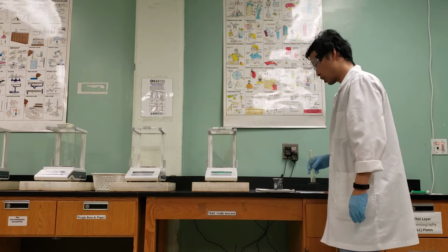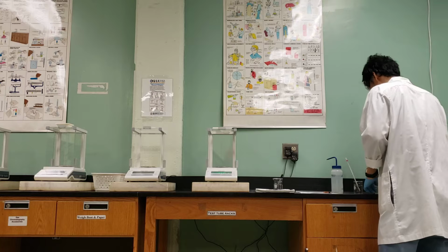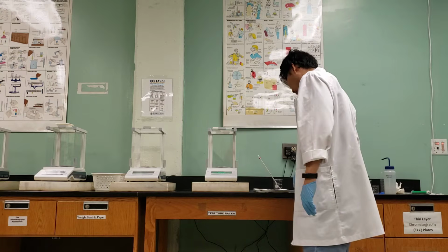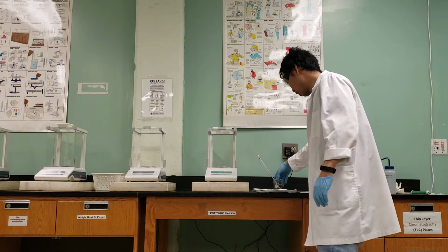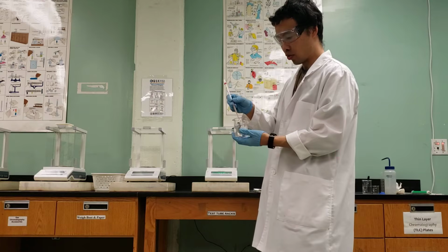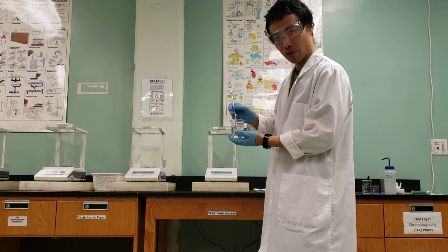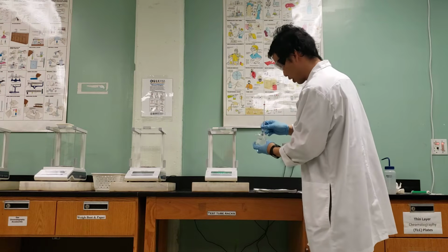Part B is called accuracy and precision of volumetric devices. So I believe the first step says to pour about 100 mils of water into a 150 milliliter beaker to measure the temperature. So here I've gotten a thermometer from our drawers. I'm going to measure the temperature. Whenever you measure the temperature, your probe should not touch the glass. That will affect the water temperature. So it's been sitting here for a bit. I'm going to read the temperature here, again at eye level.